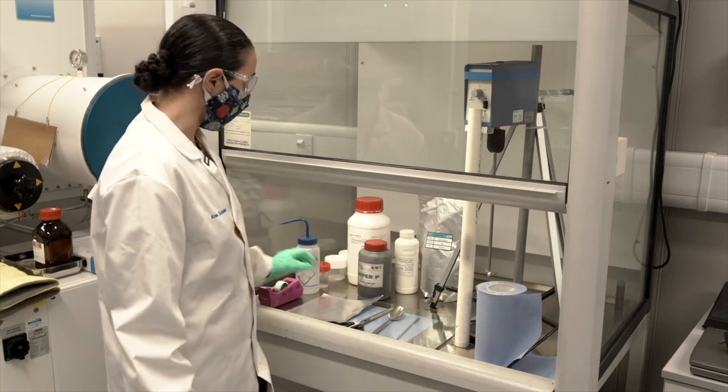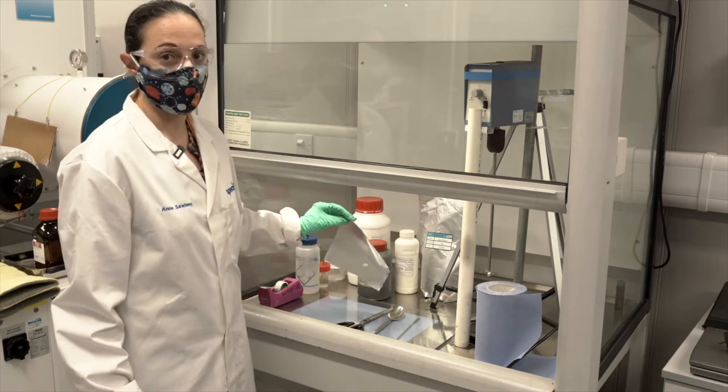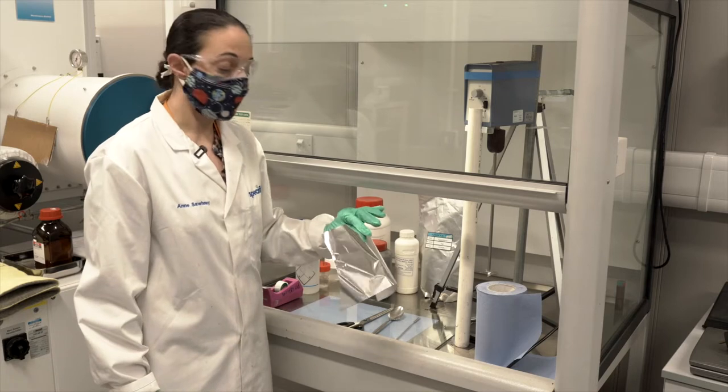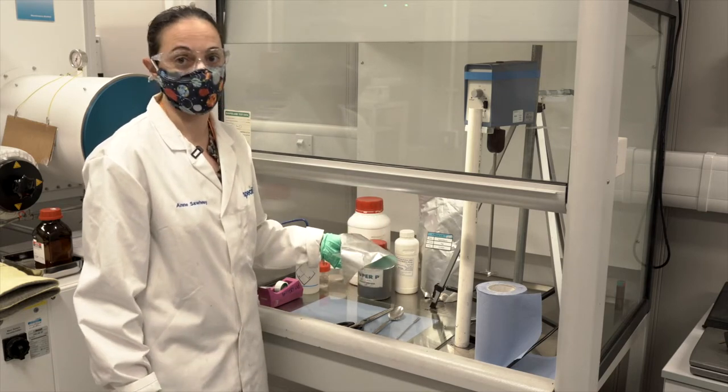And I'll be spreading onto, as my substrate and my current collector, aluminum foil, 15 micron thick from a battery research supplier.